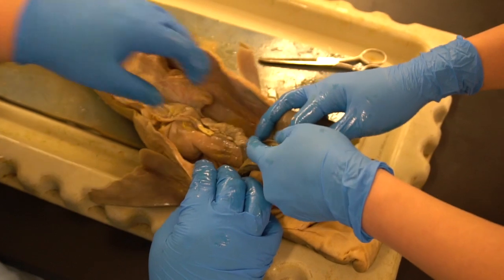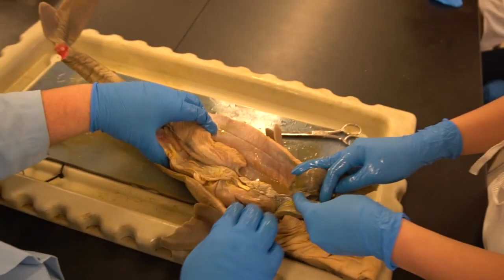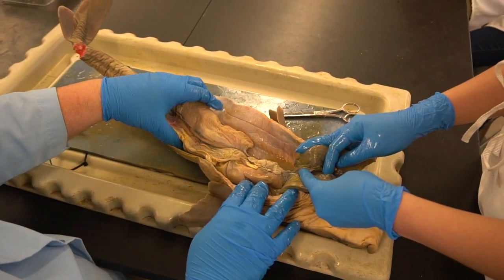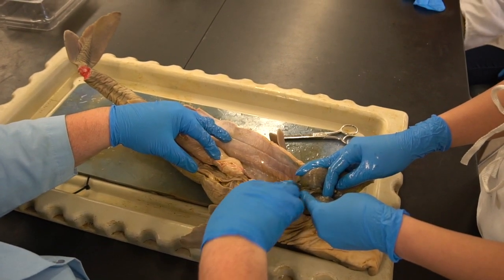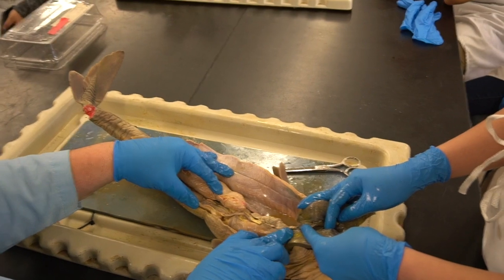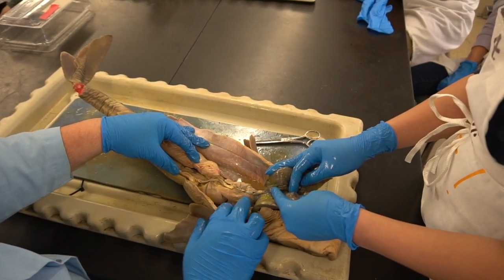All right, now when you get your own specimen, at this point, the instruction would be to remove the liver. But since I want to preserve this, it being the pregnant female, I want to preserve it better. We would cut this out in your dissection. That way you can do the other organs. You can cut it off right at the top so you remember where the liver goes, but remove it so you can see the rest of the anatomy.